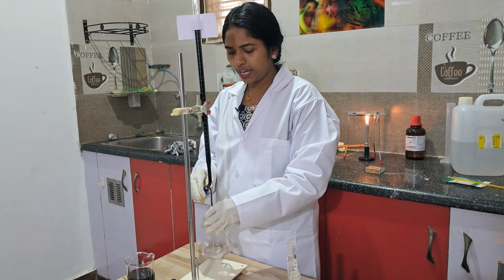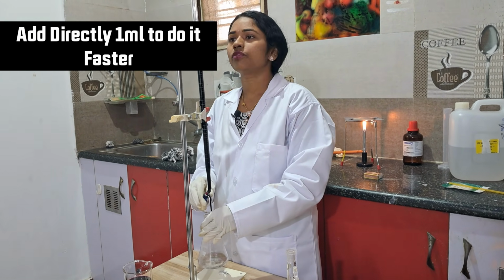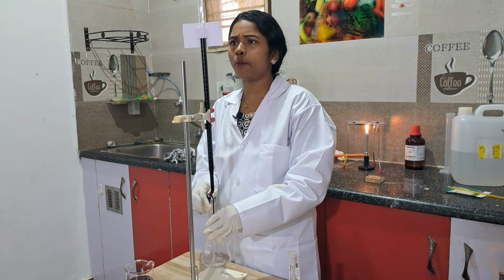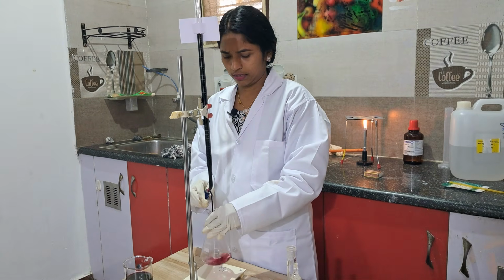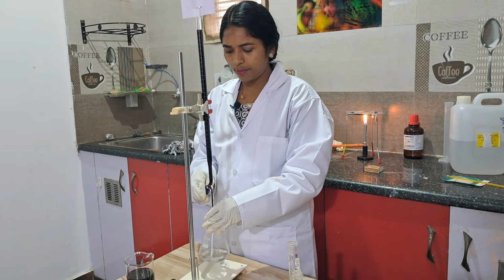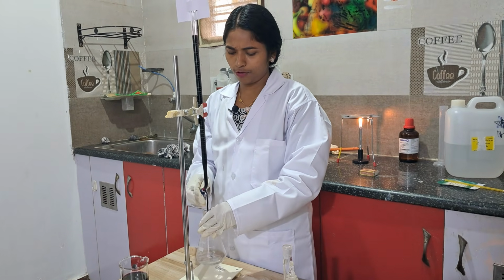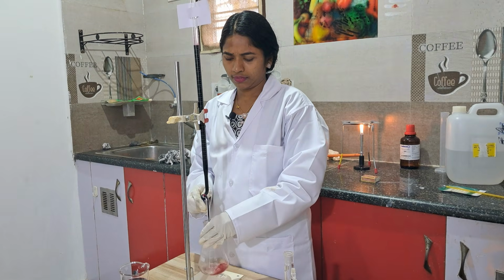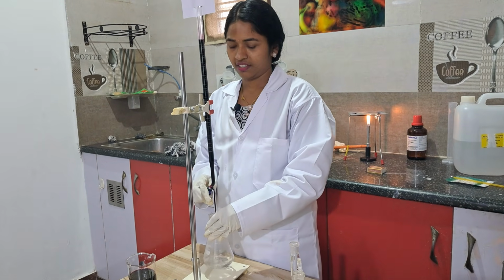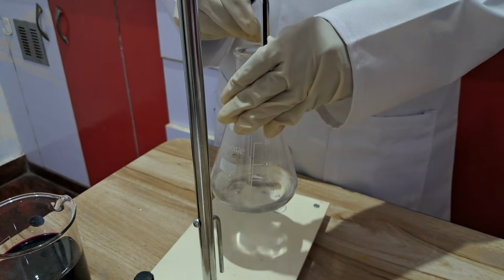Now start. You can add 1 ml directly. Add 1 ml, you can do it faster, no problem. Adding 1 ml is a technique, no need to do drop by drop. See how nicely we can do. Add again 1 ml. If you feel you can't add 1 ml, you can add 0.5 ml, no problem. Again adding 1 ml. See how nicely it is reacting.